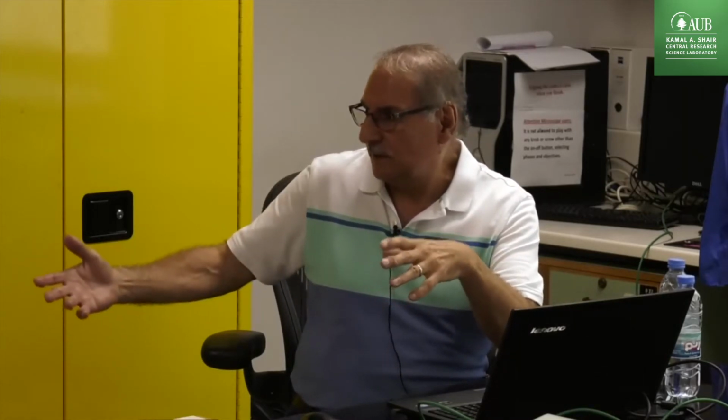This is physical. So in order to avoid this long analysis time, we have to use a very small amount of sample, like in this case, we used 5 milligrams. This is why it's so fast. Even though we did not take this point, it finished during the night. We put it last night before we left at 7 o'clock, something like that, and this point was done.